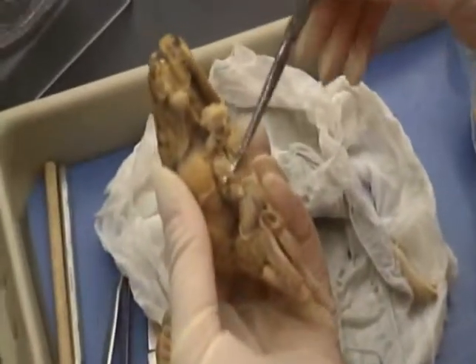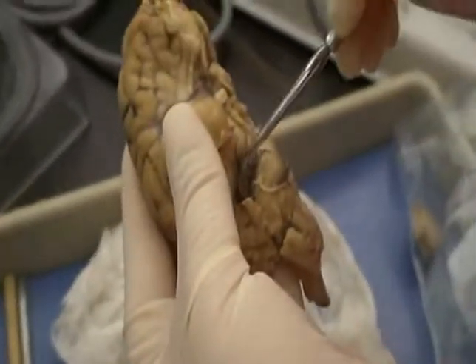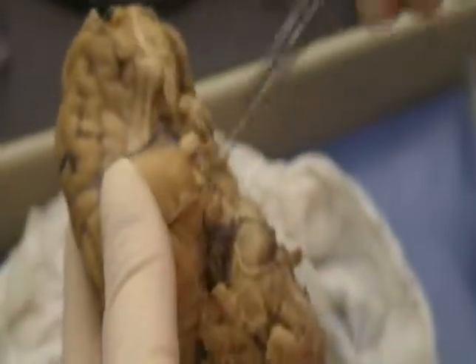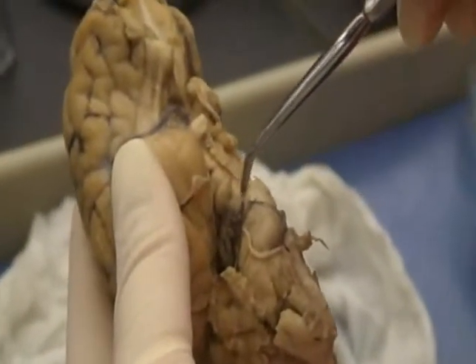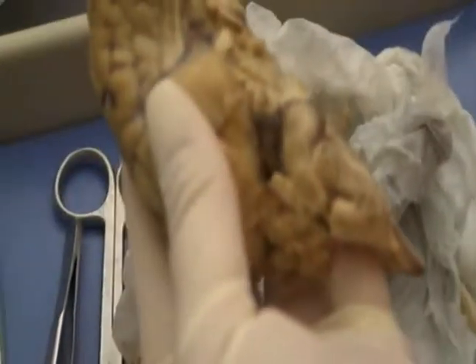Oculomotor nerve, I gotta see if it's there. It's right here. Okay. Trochlear nerve would originate down here, and it may not be there all the time, but it would originate. It's very thin, comes up and down through here. Trigeminal nerve came off right here, and it's the big nerve that you saw when you took off the meninges.